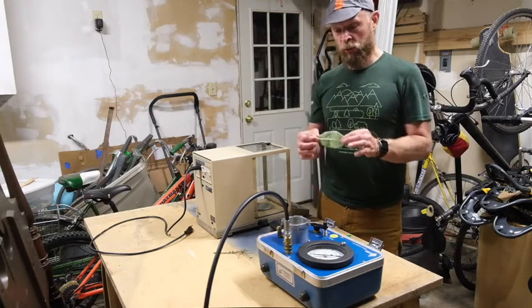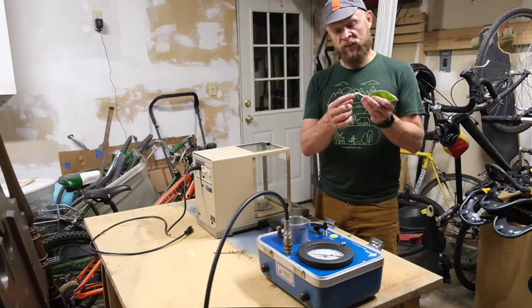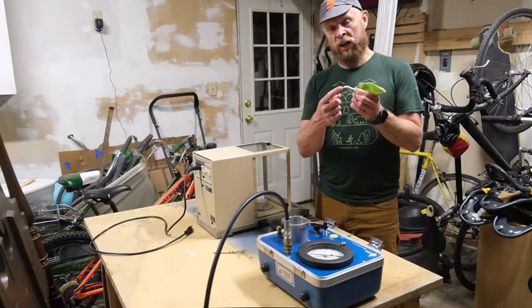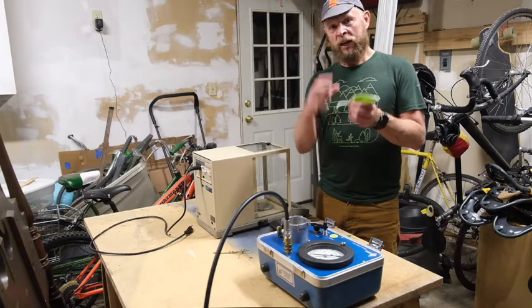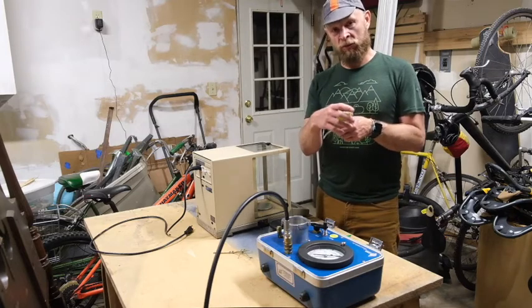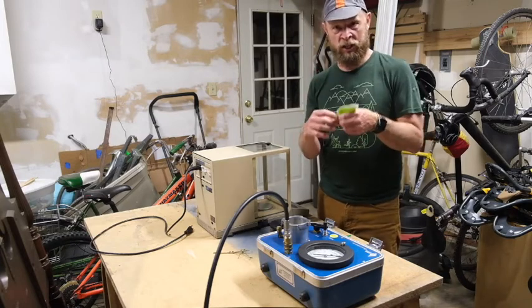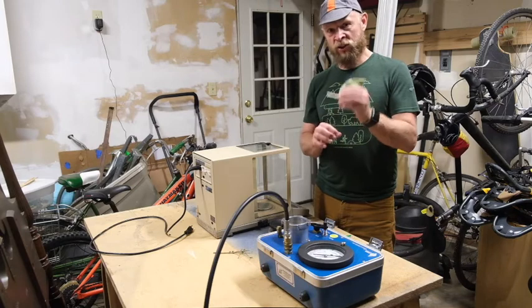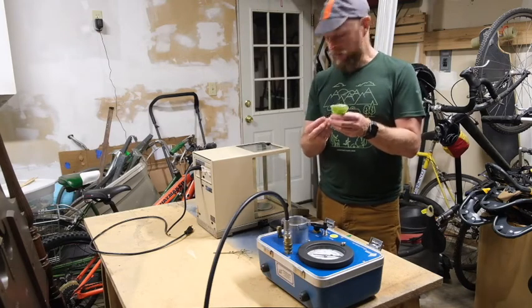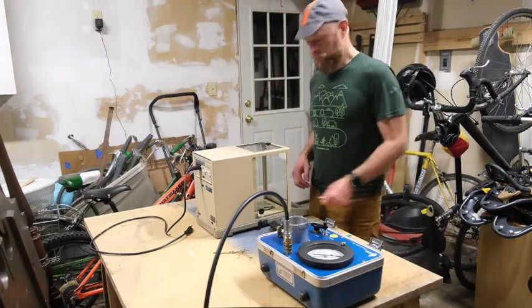So if I were doing this for real, I would have had this leaf, or the cut part of this leaf. I cut this off a plant just a few minutes ago. I would put this cut end in some water, cover this in black plastic to allow the leaf to fully hydrate, because we want to start with it in the healthiest condition we can. So we would fully hydrate it, and then when it's fully hydrated, I would make sure it's all dry on the outside, and then I would go ahead and weigh that leaf.